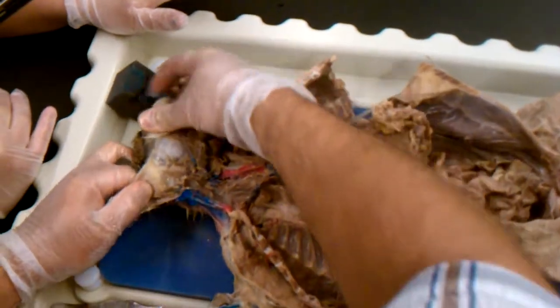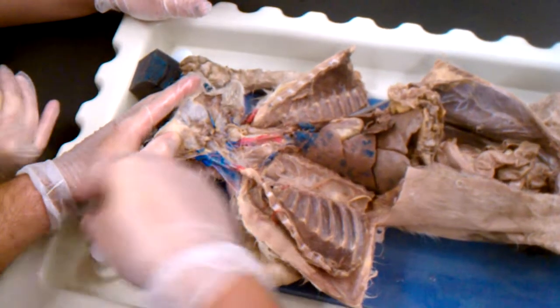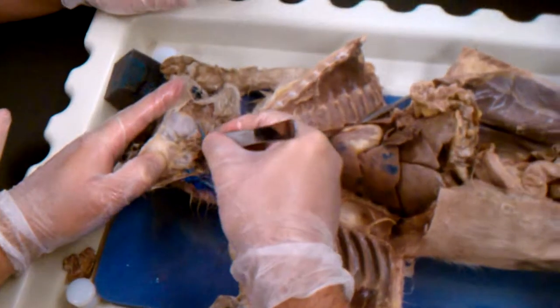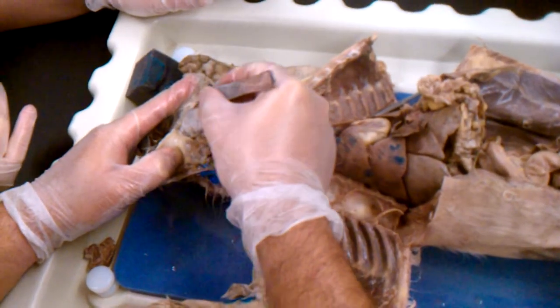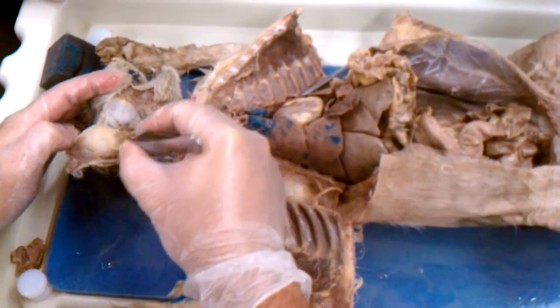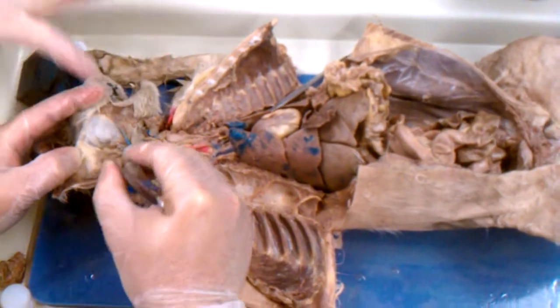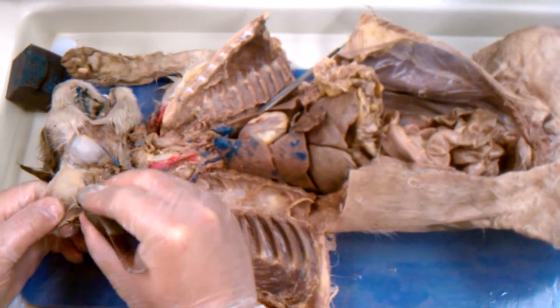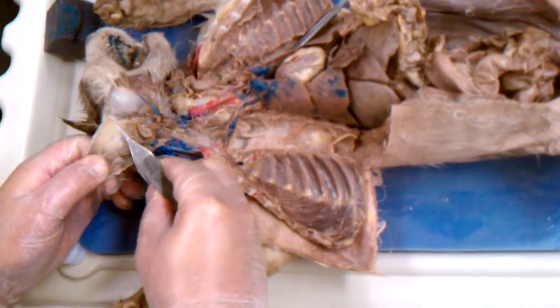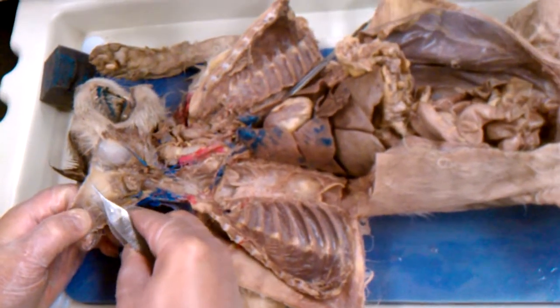Someone's got the sheet. What does it say? You need to know both of them on the cat. The parotid gland and the parotid duct. Where are they? The gland is right here, and then the duct. And actually the duct is on this side. See the duct right here? The parotid duct is the white thing. Is it a vein or a tube of some sort? It's just a passageway. Because if I had cut just a little bit thinner, it'd be like this.